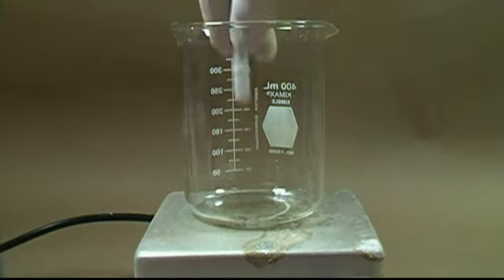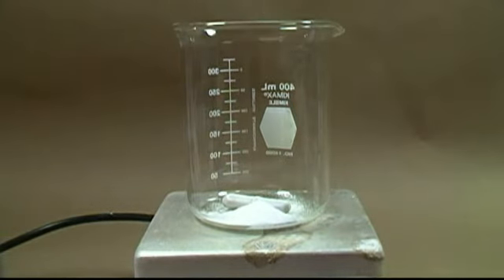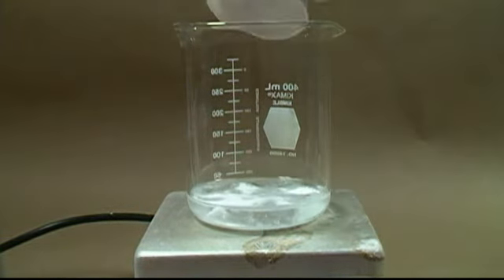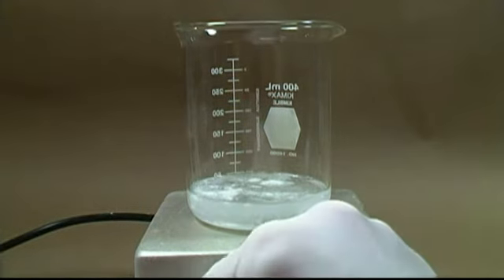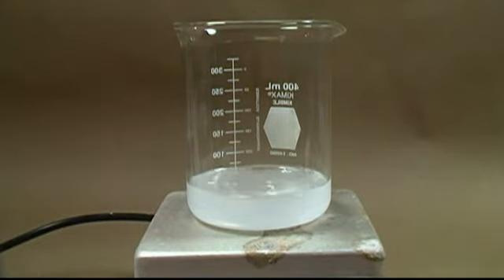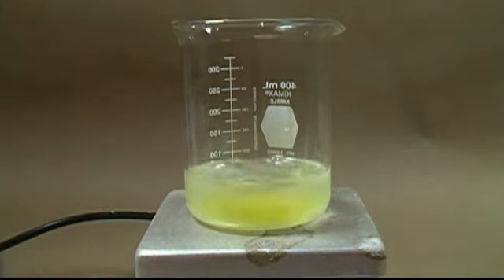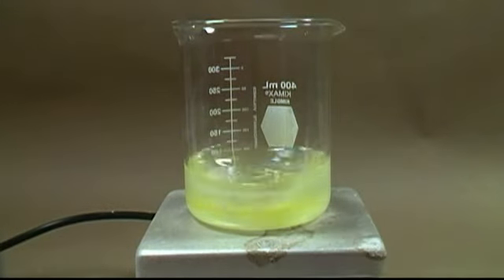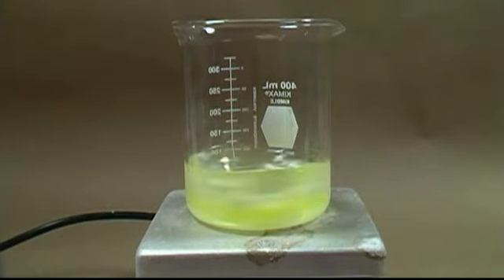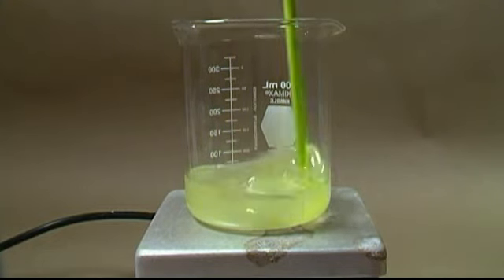To begin we'll need to sensitize some paper. Start by placing a beaker on a magnetic stirrer and add five grams of ammonium chloride. Next add 50 milliliters of water and then add 5 milliliters of ethanol. Now add 50 milliliters of egg whites and begin stirring as fast as it can without splattering. The egg whites will be our binder for the ammonium chloride and paper, and the water and alcohol are there to dissolve the salt and the egg white. It's important to mix this well for about 10 minutes.